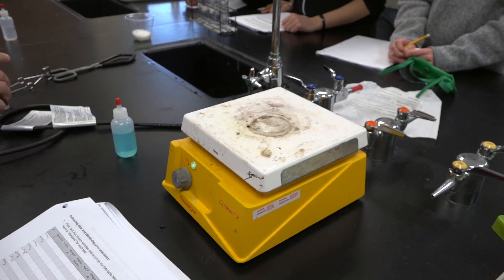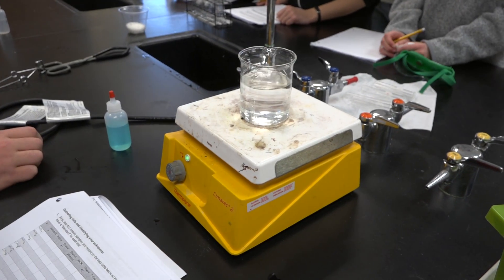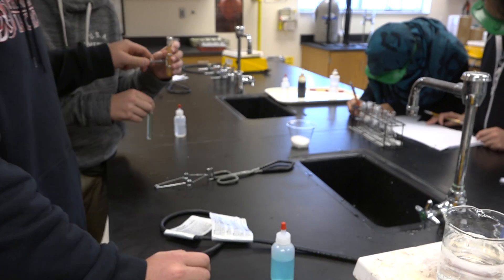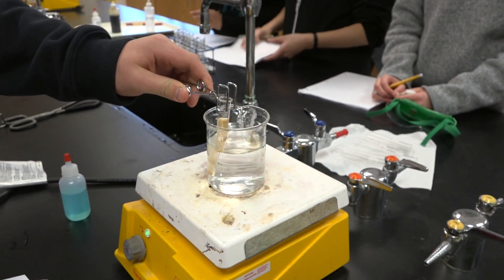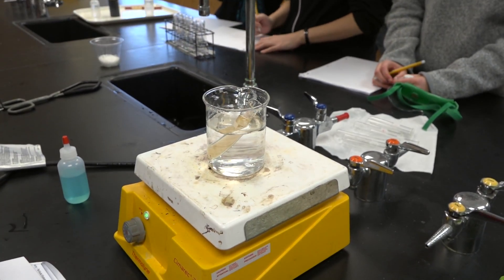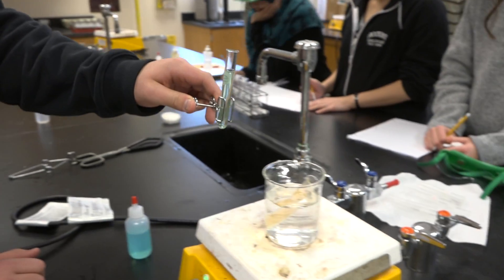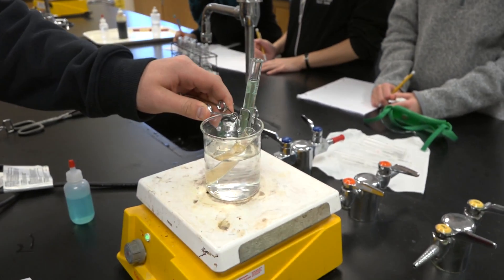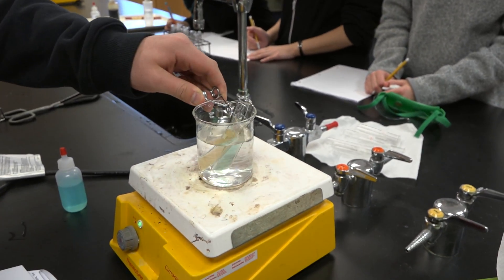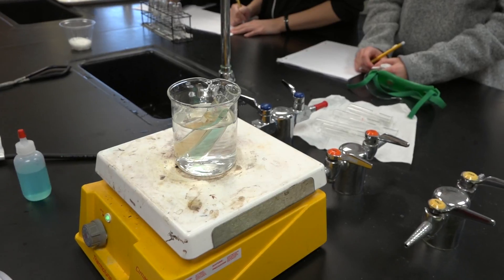We're trying to find the difference between sucrose and fructose. To do that, we are putting the two elements in a copper sulfate solution and putting it on a hot plate. The one that reacts and makes pure copper — that is the fructose.